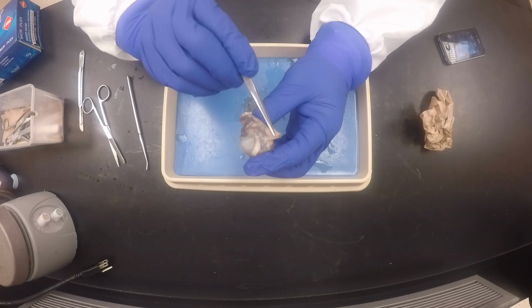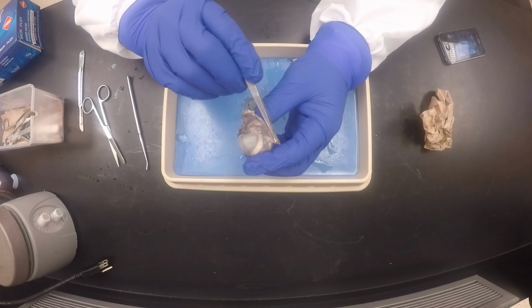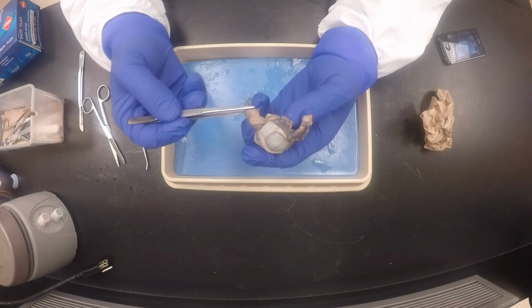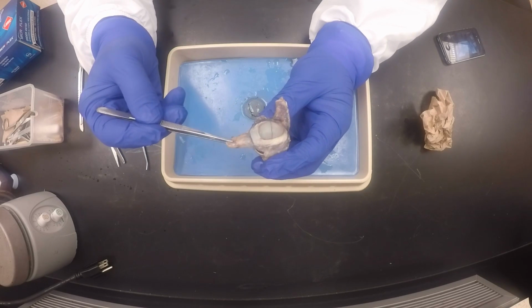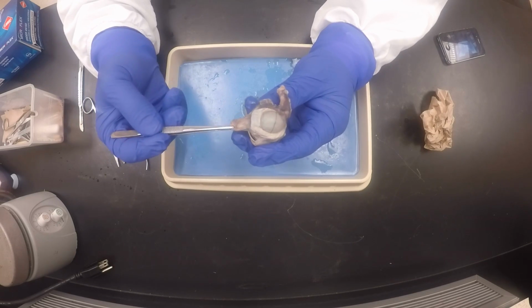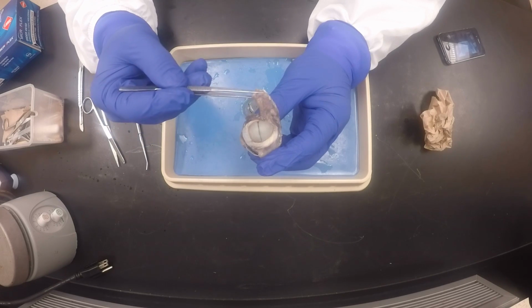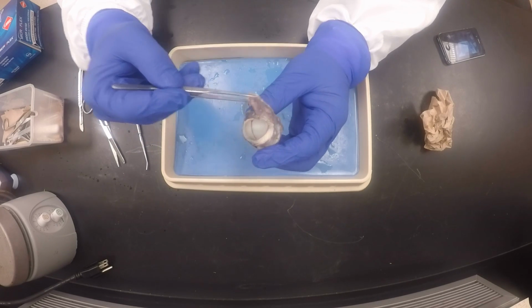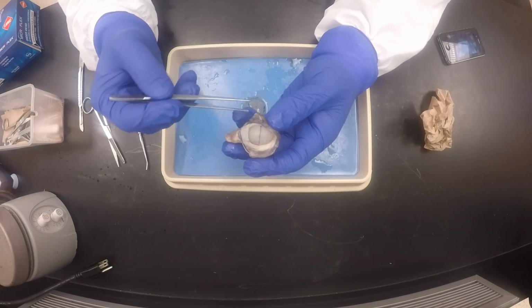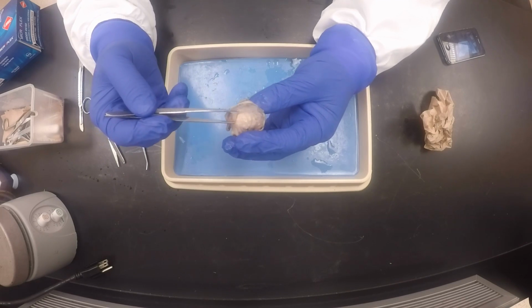If this short side has the lateral rectus, which means it's on the outside, then the other side where we had that one muscle is the medial rectus, the one towards the nose bridge. Medial rectus. Then this is the inferior rectus right there, this is the inferior oblique, and this is the lateral rectus. By default, if this is the inferior side, the other long side has got to be the superior side. So that's the top of the eye.